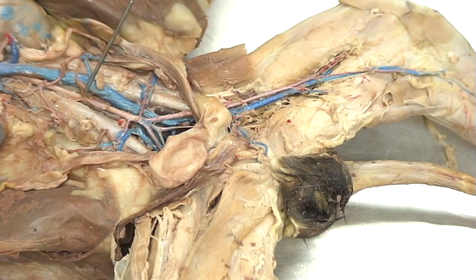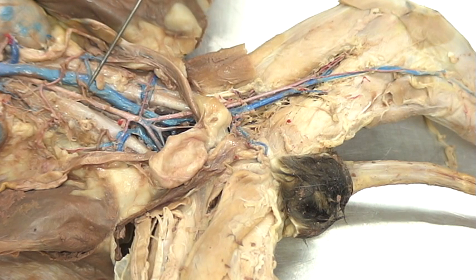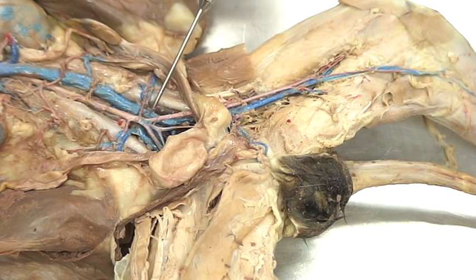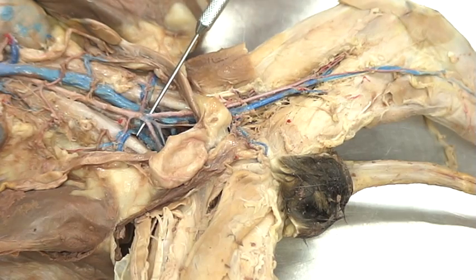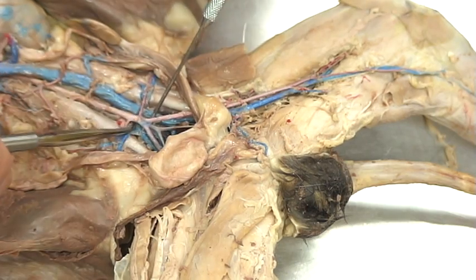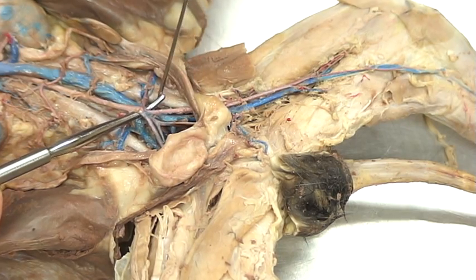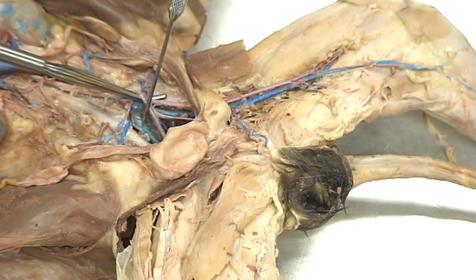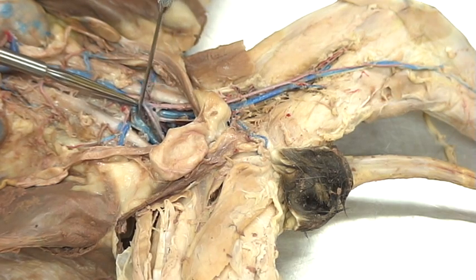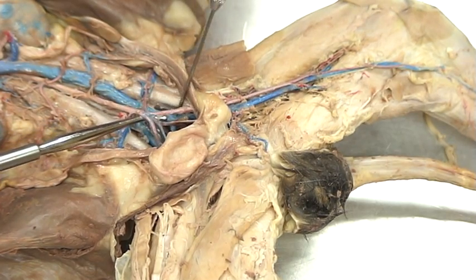Now, we're going to be looking for a split. This is where it gets kind of interesting and challenging, because we're used to seeing the veins on top of the arteries, but here you'll see that the aorta — the abdominal aorta — actually goes over the top of the veins. So I'm going to have to move the arteries away to see the veins. We're going to see that the artery will actually be hiding a split in the vein. Most cats will see that the split will take place pretty evenly. In this cat, however, we'll see that the split goes a lot higher up on this leg, which is the cat's right, than on this side, which is the cat's left.